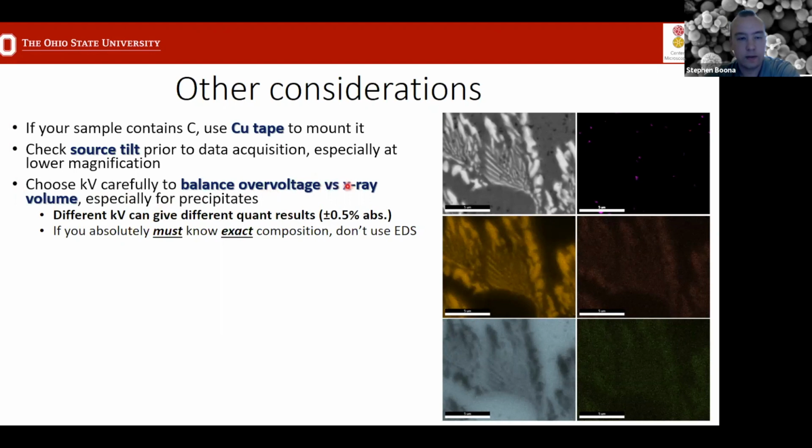I didn't really talk about these, one of the background topics that we skipped, but especially in situations like this, I see a lot of people with these kinds of samples where you have intermetallic phases or precipitates that form, and you want to do some composition analysis of these features. Well, you can see right away in the backscatter image here that they're kind of fuzzy on the edges, which tells us that at this voltage, we are seeing some penetration through the surface, and that's going to affect the area of the material that we're getting our X-rays from as well, which means that if you really want to determine the composition of these two things, you need to make sure that you're only getting X-rays from one or only from the other. So be extra careful if you're dealing with small precipitates and similar.